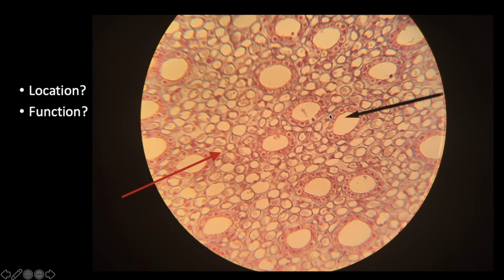Also, if you're looking at how many nuclei you can fit in the intercellular fluid, it looks like you can fit maybe 2 or 3 nuclei into a single cell. You've got a cell, cell, cell, cell, cell. That's how you can tell the difference. That's one way that you can differentiate this one from simple squamous epithelium.